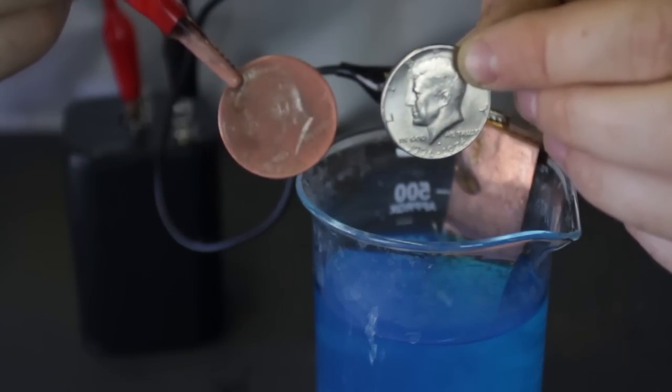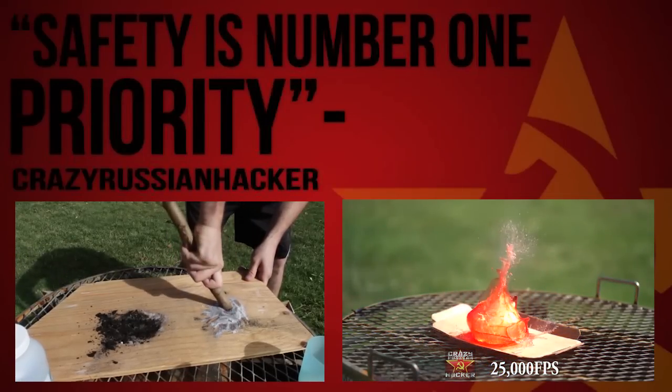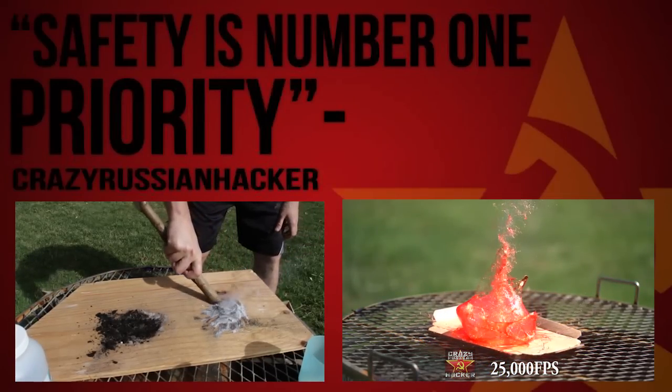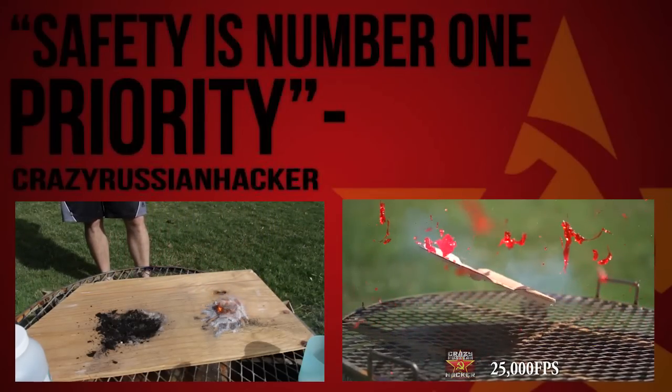Awesome, huh? I love science experiments. And boom, that's it. Awesome, huh?